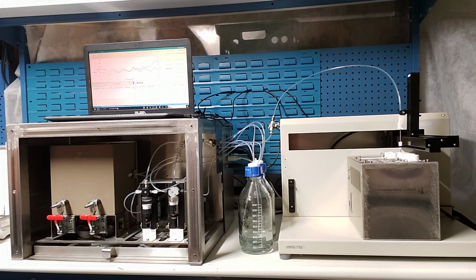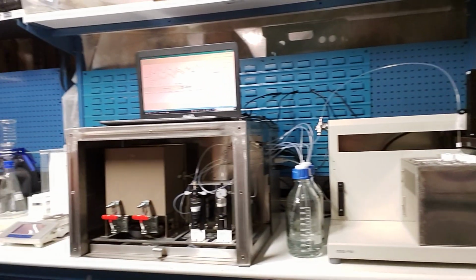The loading and analysis takes place in an automated fashion. No user intervention is required. In fact, these samples were weighed out earlier today using the connected analytical laboratory balance you can see here.